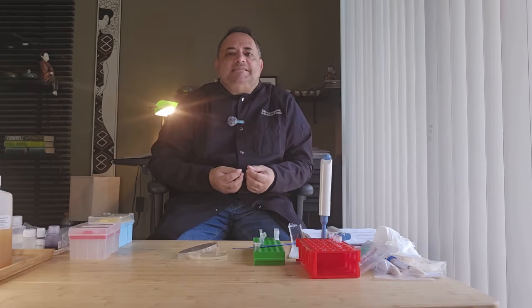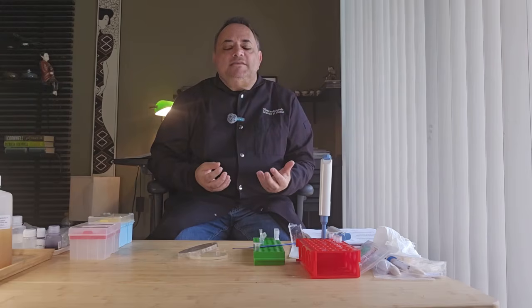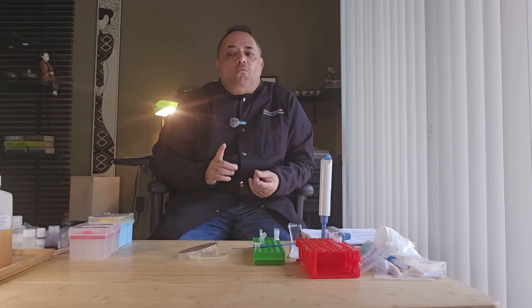It changes a single DNA base so that the lysine amino acid at position 43 is turned into threonine. The genome of the E. coli bacteria that we will engineer is over 4 million DNA bases in size, and CRISPR will find the single one that needs to be mutated.